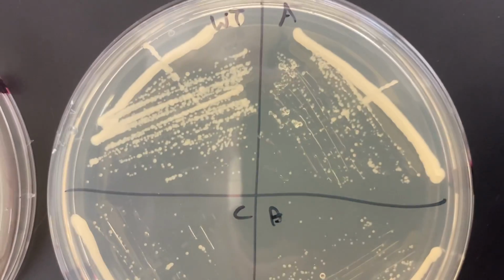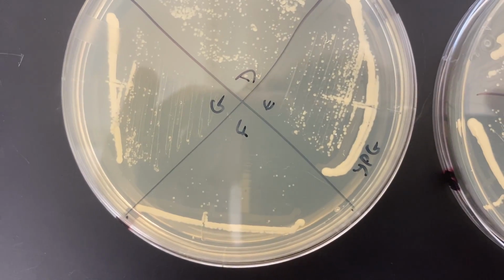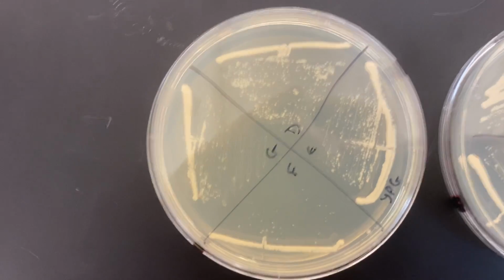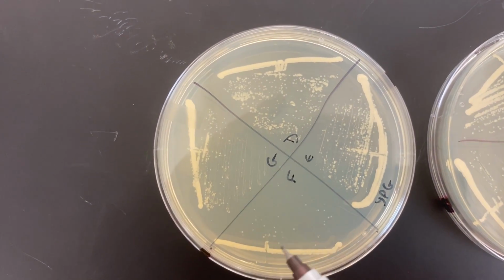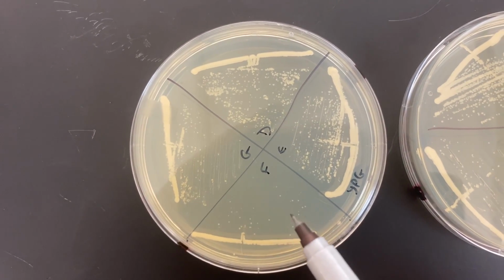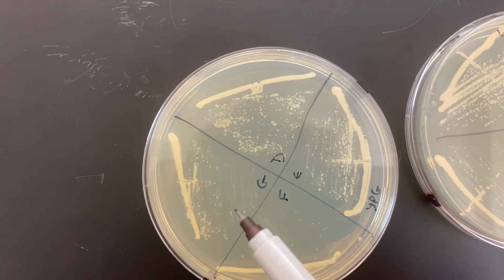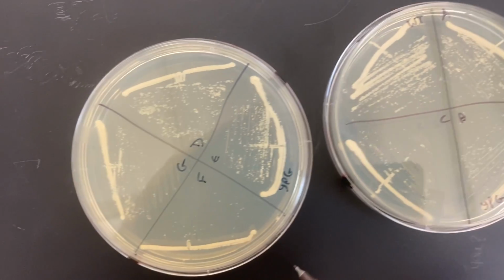And so comparing those across the suspected mutants, everybody's got pretty small colonies. Some of these are a little bit interesting, maybe something you'd want to test a little bit further, but say F here has the dense streak there, and then a pretty sparse streaking in this area. Same for G, pretty sparse out in this area. Could be the result of differences in streaking, could be that cells were put in here that didn't grow up.